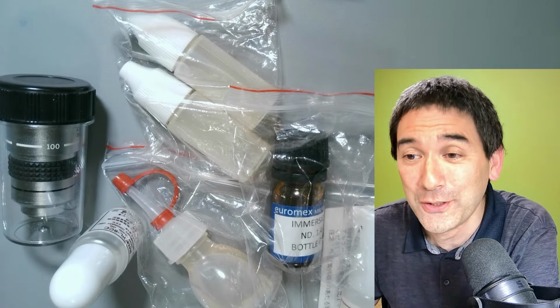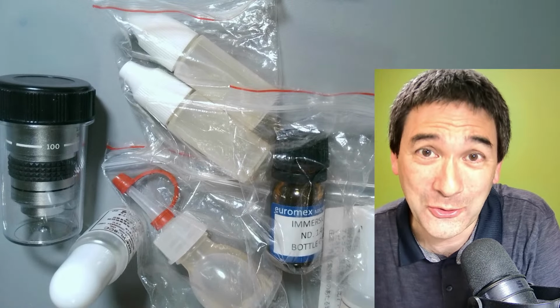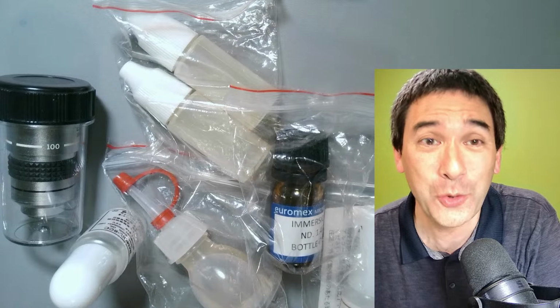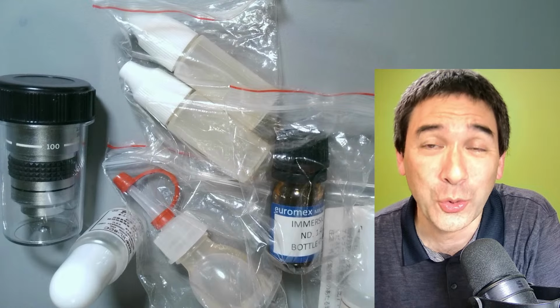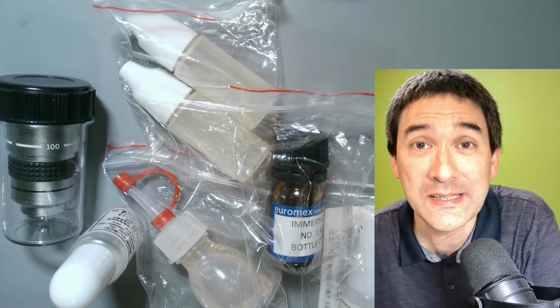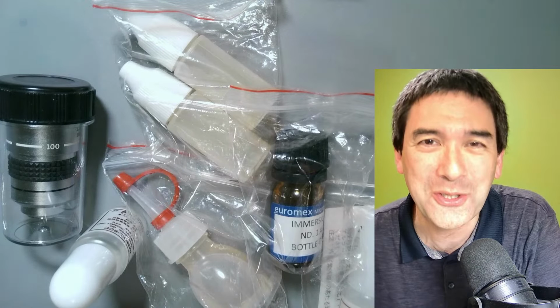Sound is good. Today, as requested last week, I would like to talk about oil immersion microscopy. Not the first time that I'm talking about this topic, but there are always a few new variations to the topic. Additionally, I would like to show you how to do so-called heat fixing of slides, because sometimes this is also necessary if you want to do oil immersion microscopy. I'm just going to show it to you today.